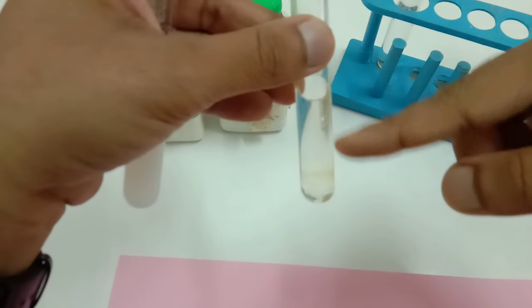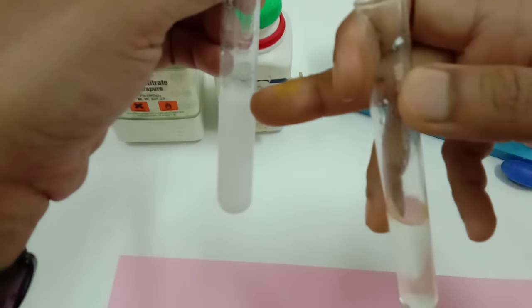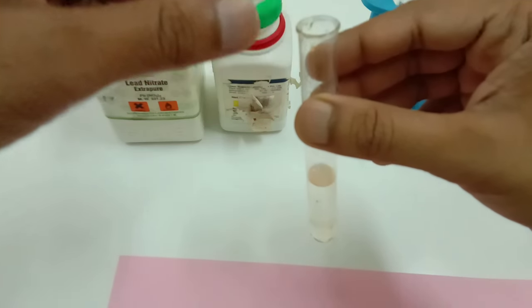Now all potassium compounds are soluble in water and all nitrates are soluble in water. Now you can add any of these solutions into one another.